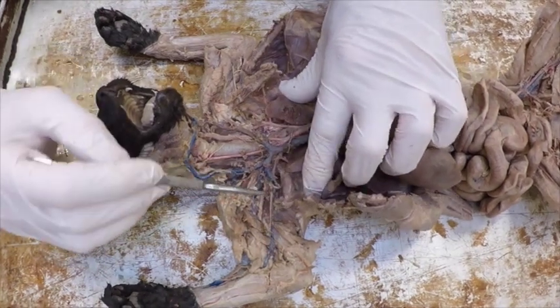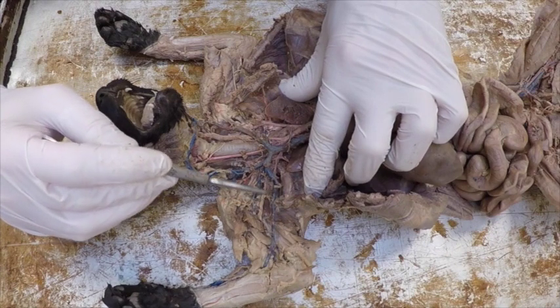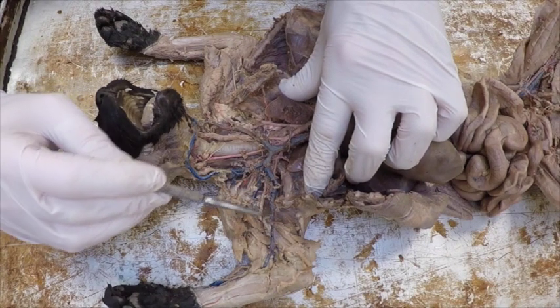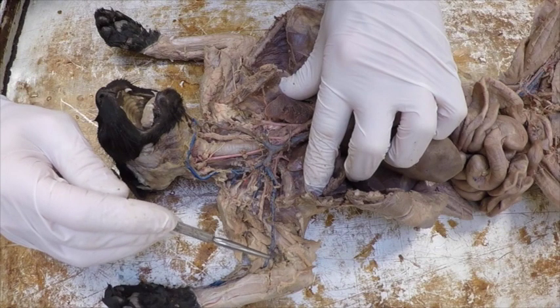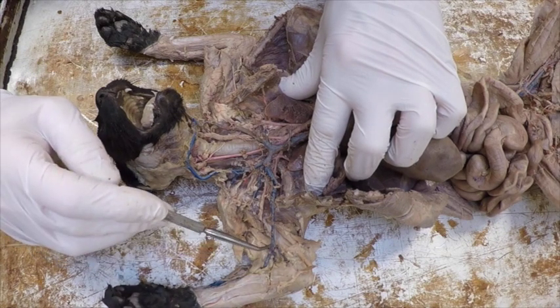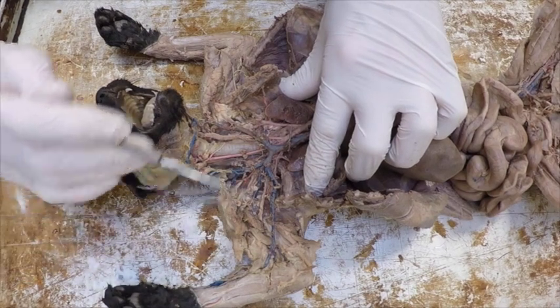My axillary vein continues out, and again, not all of these look beautiful. This is kind of beat up, but they're there. Actually, I get past this stub about halfway down, it becomes the brachial vein. When I get to the elbow, it's going to split into the ulnar vein, going towards the elbow and the ulna bone, and then the radial vein, going towards the radius. The arteries would be the same.